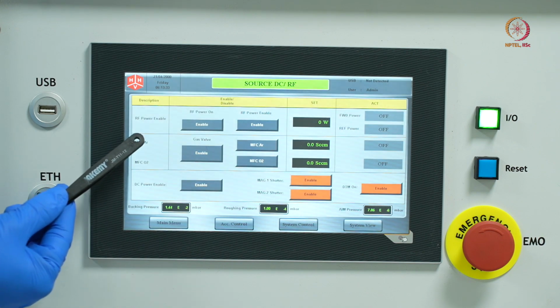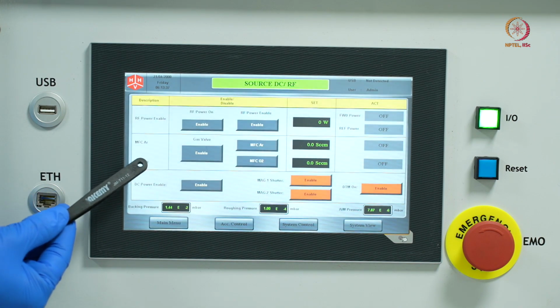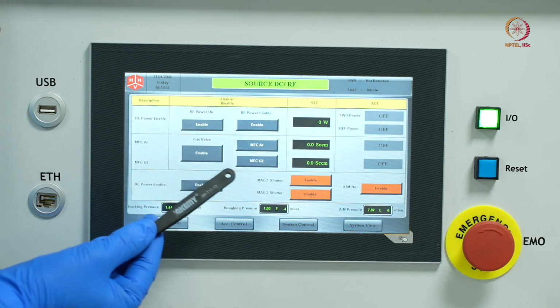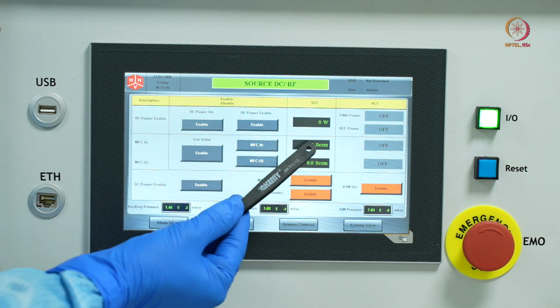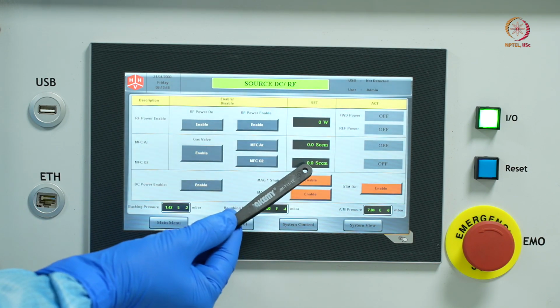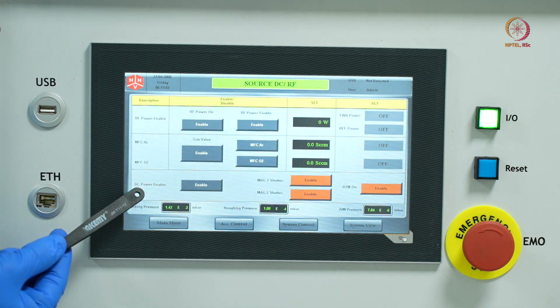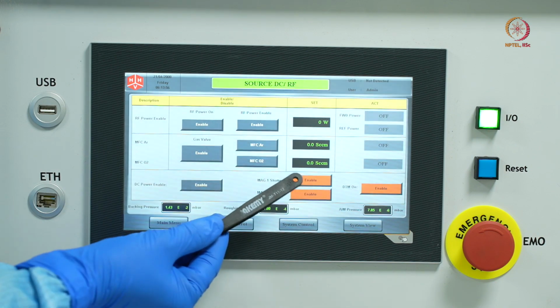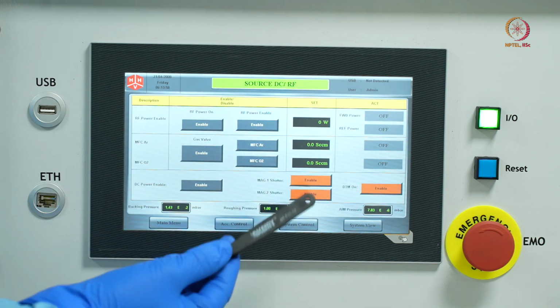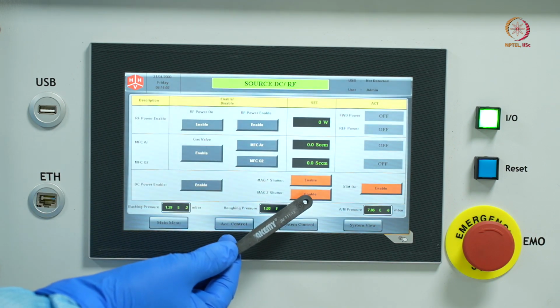And here we have options for inletting two gases. One is argon, and another is some other auxiliary gas you want. We will enable which mass flow controller, or MFC, we want, and set the flow rate and monitor them here. Next we have the DC power. We'll enable it, and here we have the shutters for two magnetrons. On the left we have RF, on the right we have magnetron 2, that is the DC.